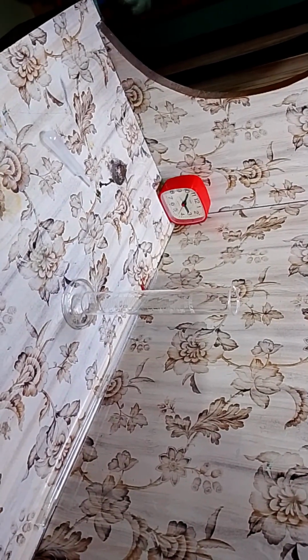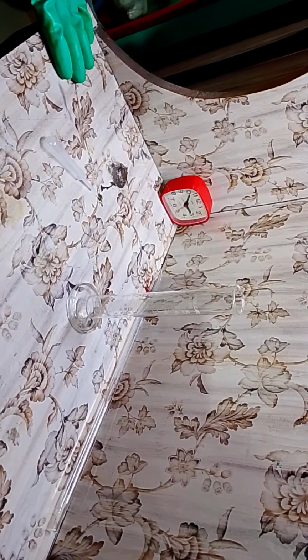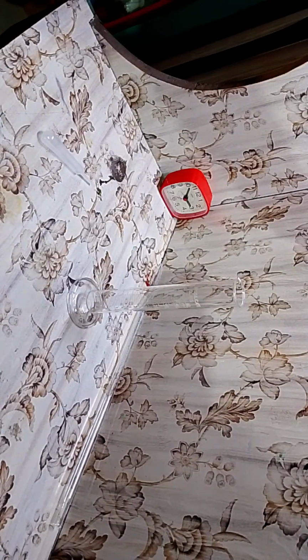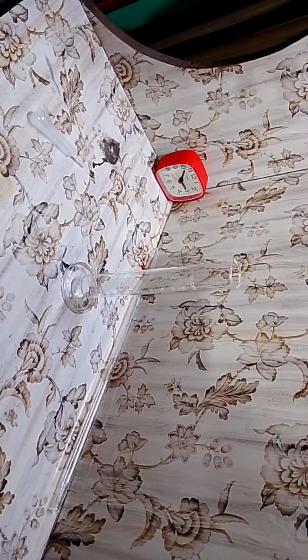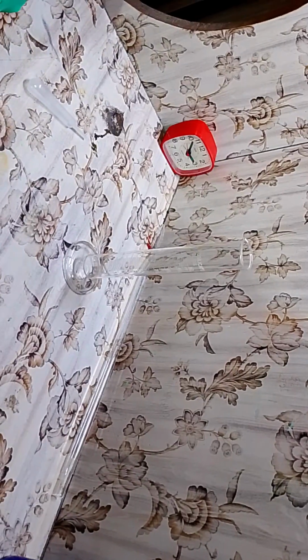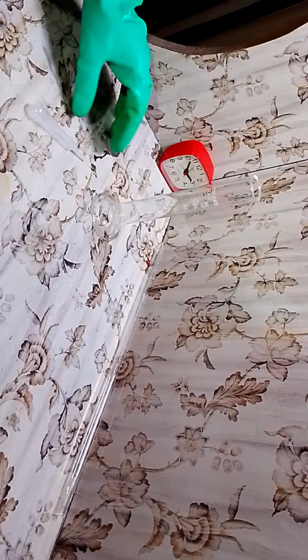Okay, so I've taken my internal table for doing chemical experiments, because the air conditioner that has been installed in my house a few days ago is now working and I cannot open the window. So no problem, we'll do it here. This is also another place for the studio. You can see I've done different chemical reactions here which might have stained the table. Okay, so we'll be keeping our sulfuric acid in this for now.